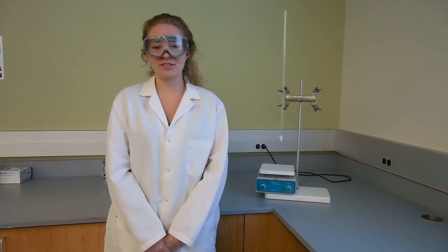Hi, I'm Jessica. I'm a chemistry major at Cal Poly, Class of 2016, and today we're going to be demonstrating a titration technique.